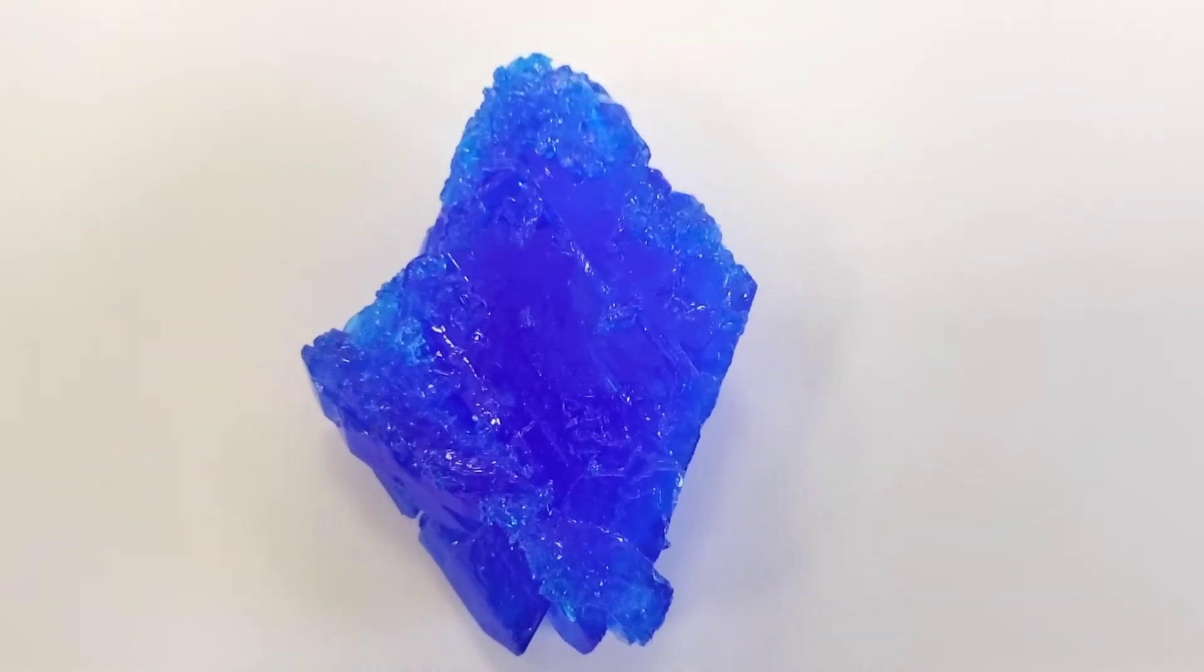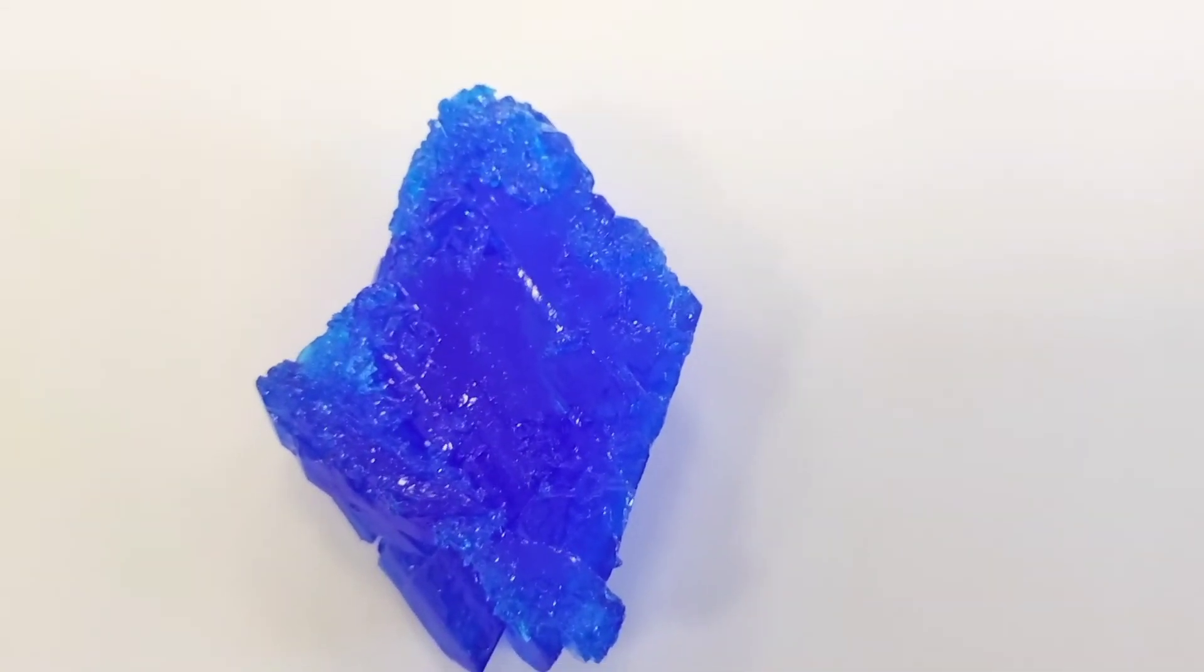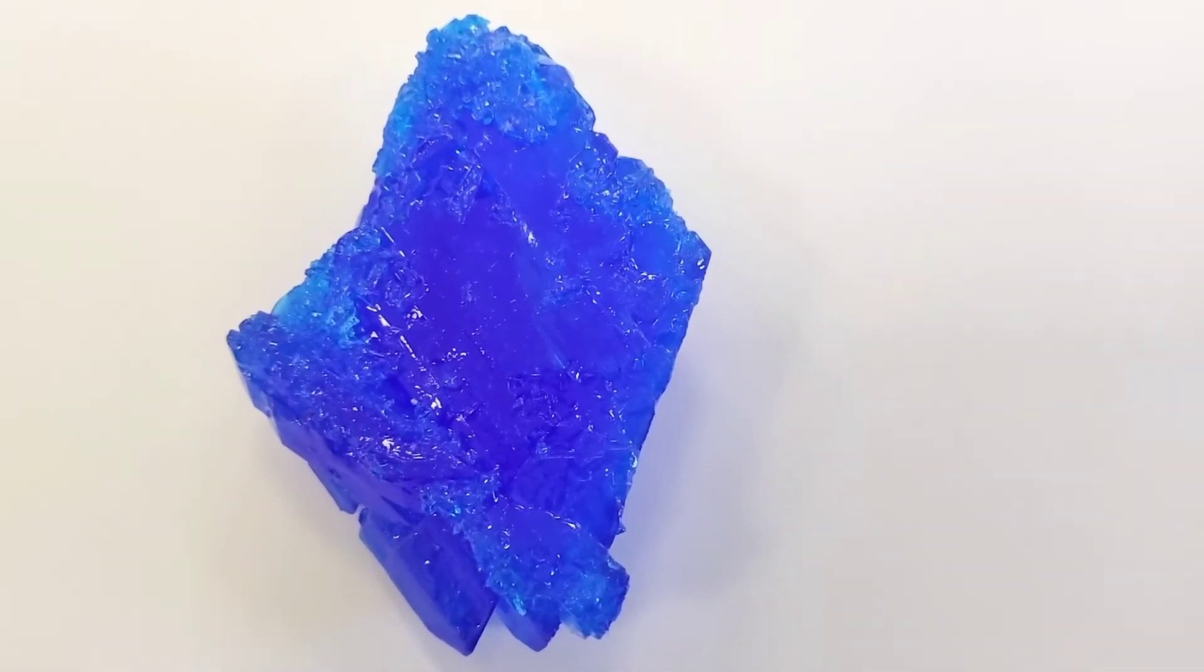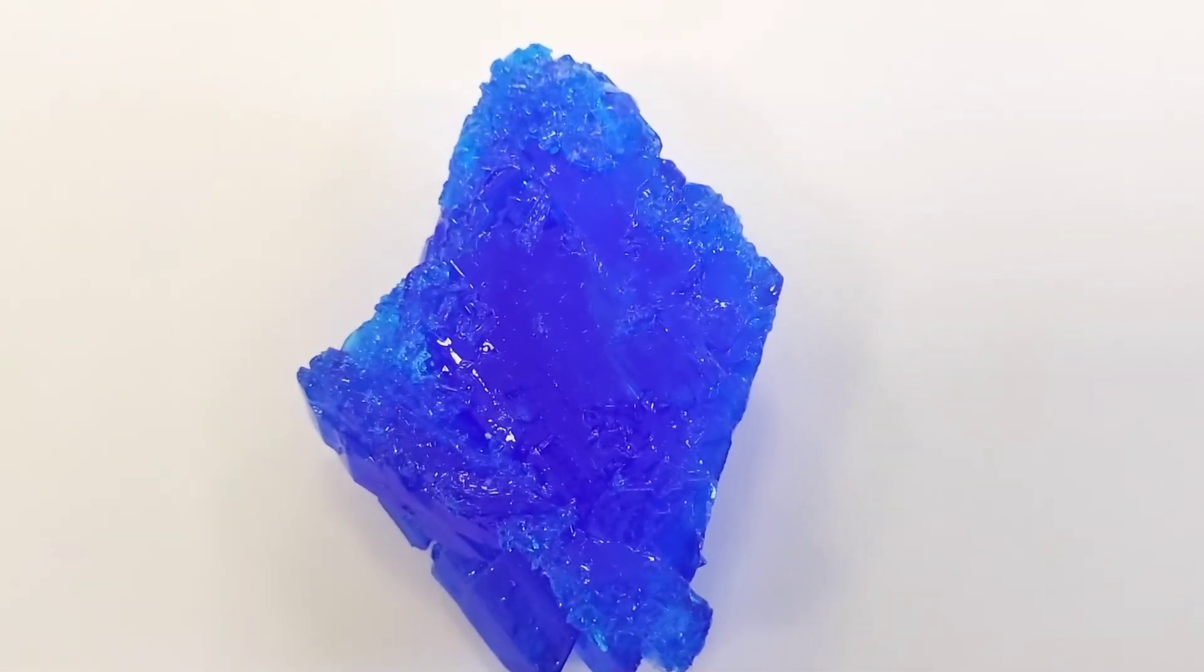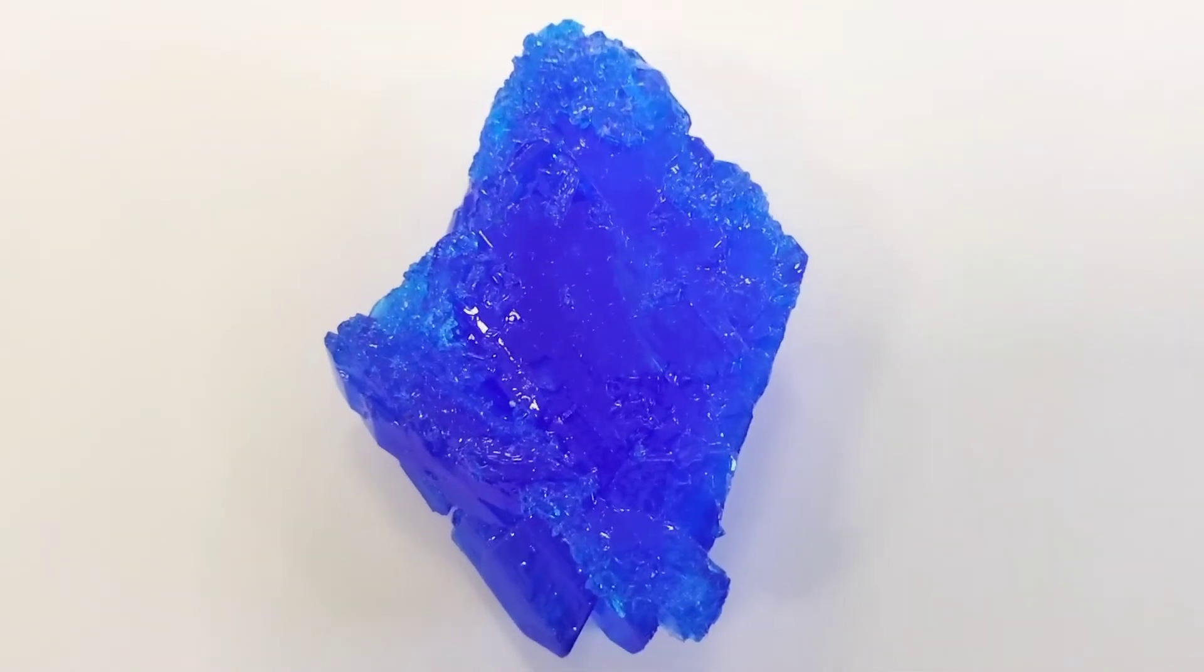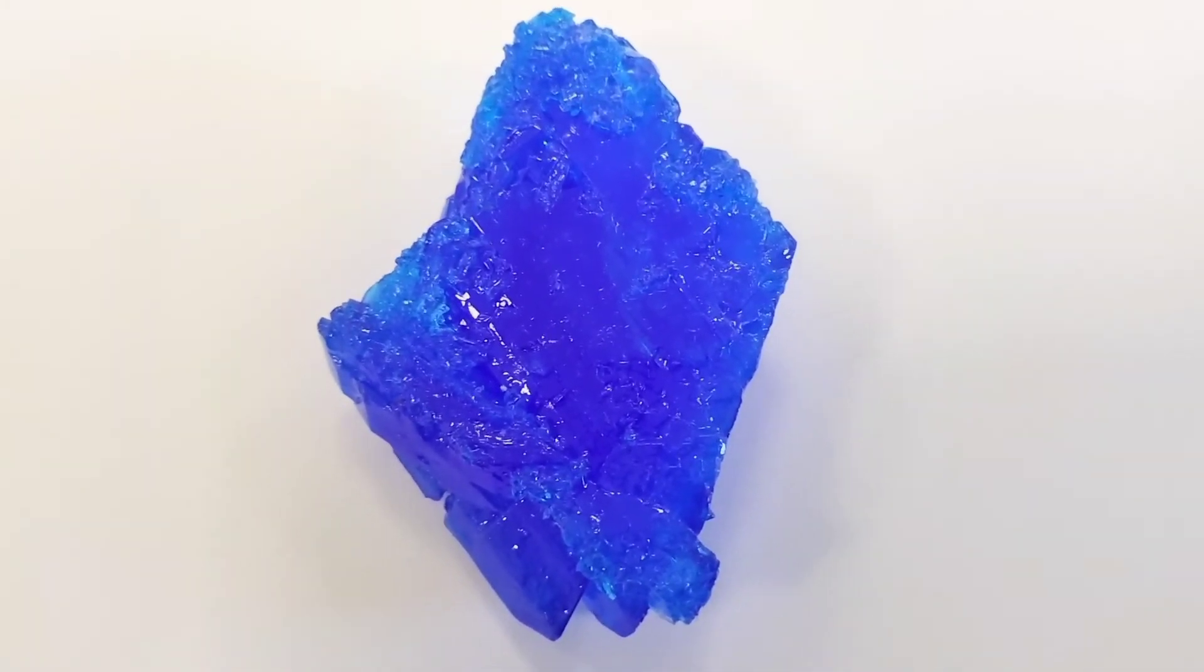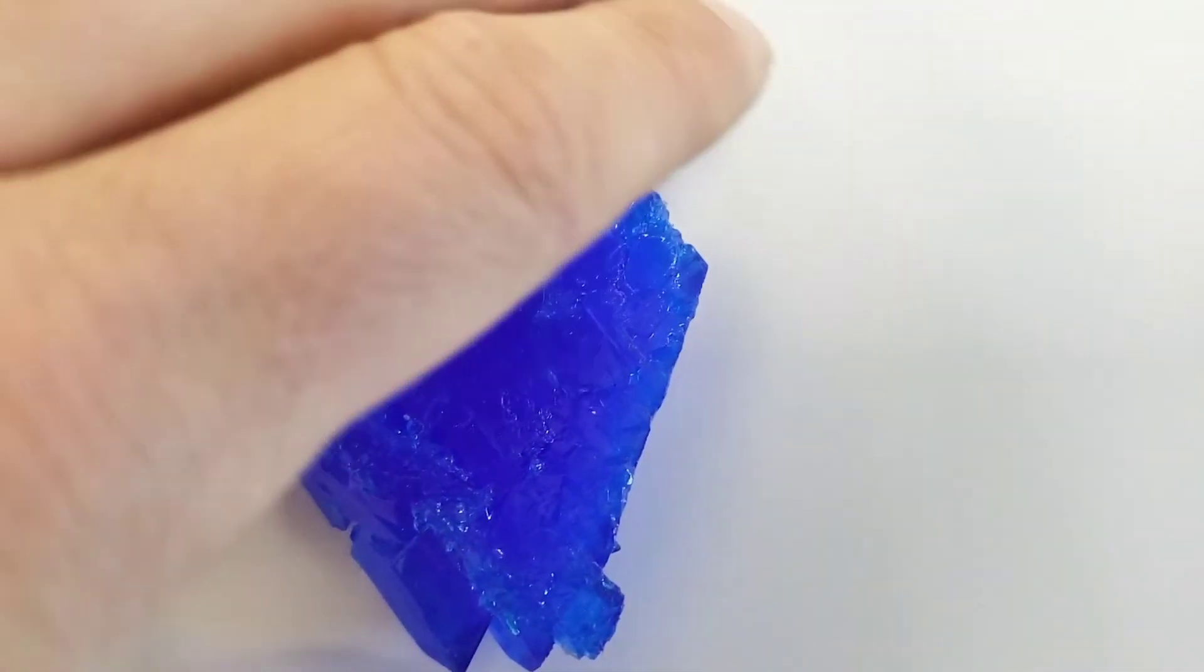I'm going to pick up the crystal so you can get a real idea of its actual size in comparison to the size of my hand. I can pick up this crystal because I've actually lacquered it with some nail varnish, meaning the copper sulfate, which is usually harmful, is perfectly safe to handle because it is covered in a transparent layer of lacquer. Here's our crystal.